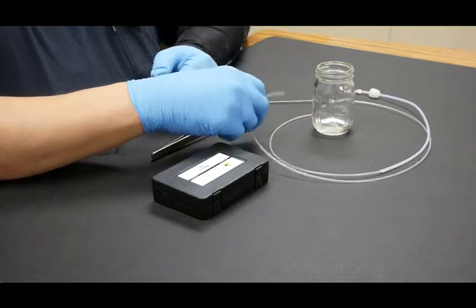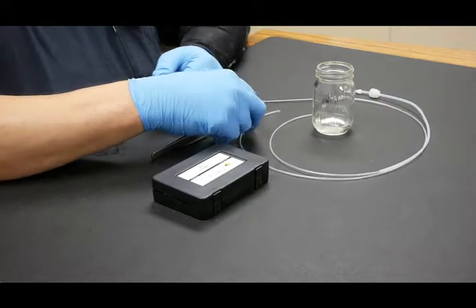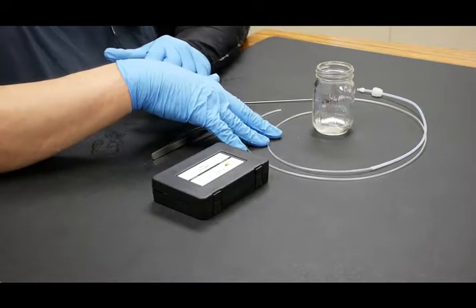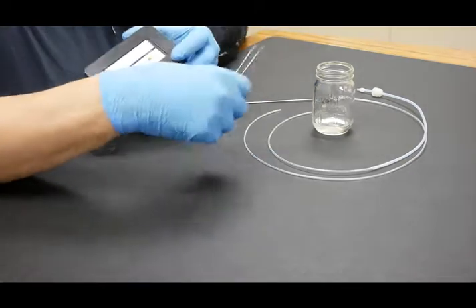You'll need two pieces of probe tubing: one for the probe itself, which is 46 inches long, one for the waste side, which is 26 inches long. Now these pieces are not cut to scale. And you'll need tweezers.